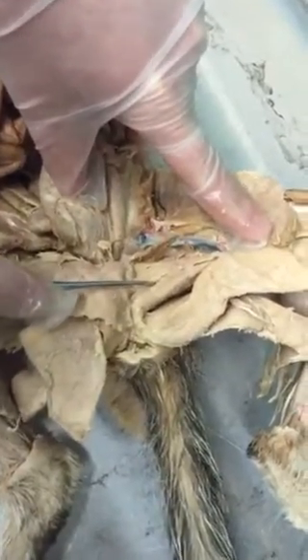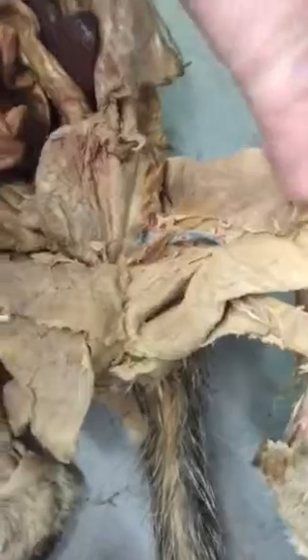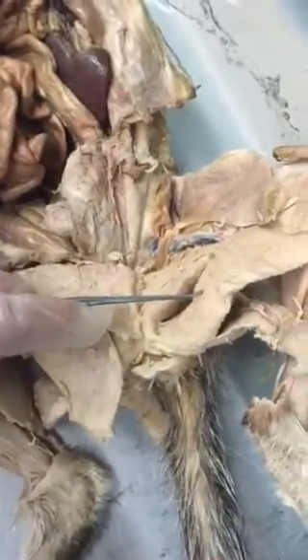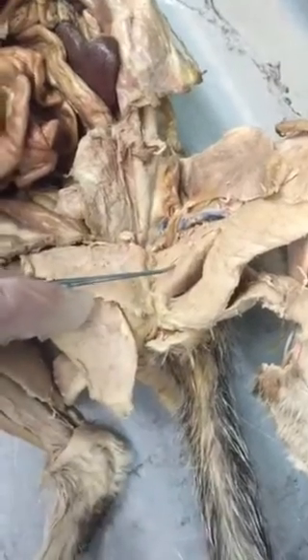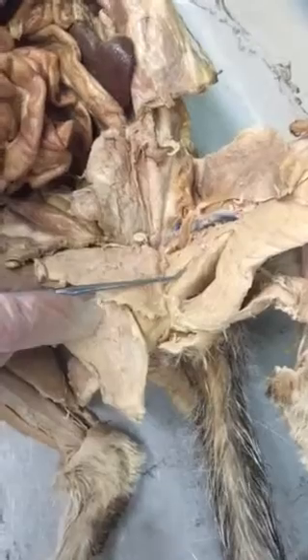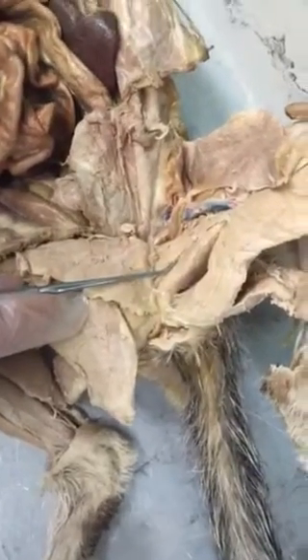You have the adductor longus, which is like a little diagonal muscle. You have the adductor femoris. The two adductors adduct the thigh. They pull it inwards. For those two, you just have to write adducts the thigh. They're called the adductors. So you just have to write adducts the femur, adducts the thigh.